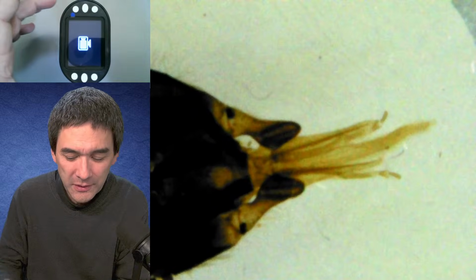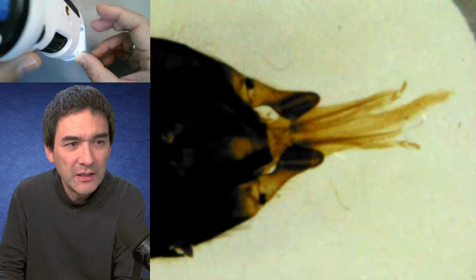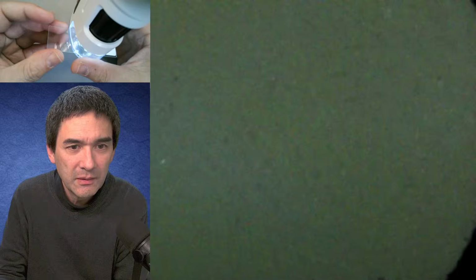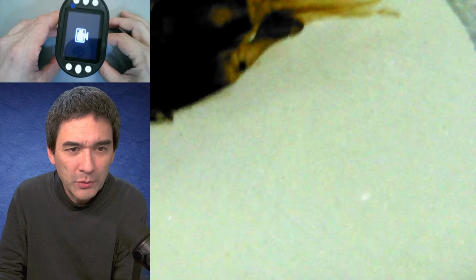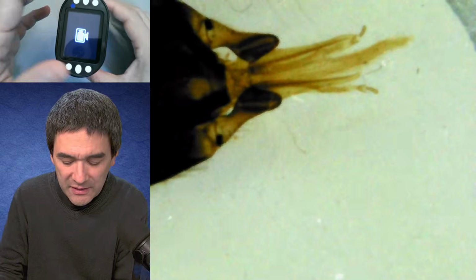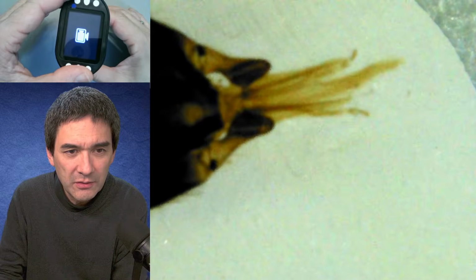But this is basically now the proboscis, which is the tongue of a bee. So what I've done, just so that you see that, maybe I show it to you on the side here. You can see it kind of slides outwards. You can basically slide it here. If you look at the top, right in here. This is so you cannot move it forward or backward, but only to the side. And then what I do now is I turn the knob, and this allows me to focus it, right?